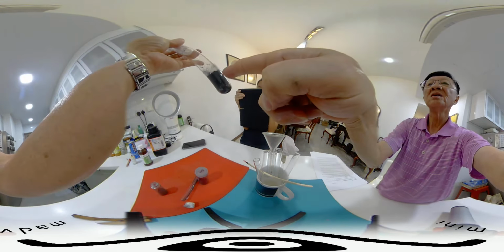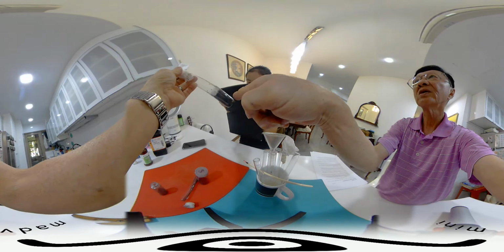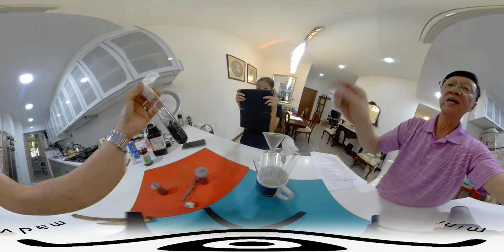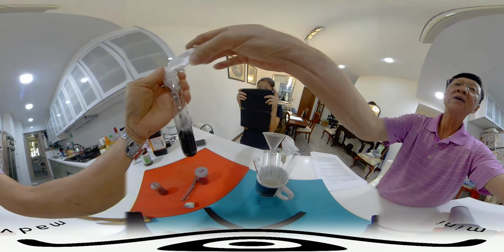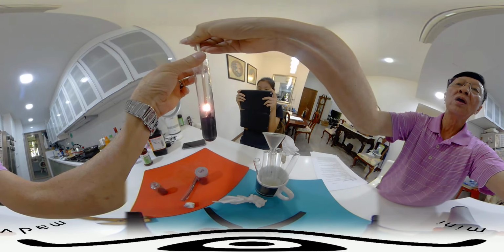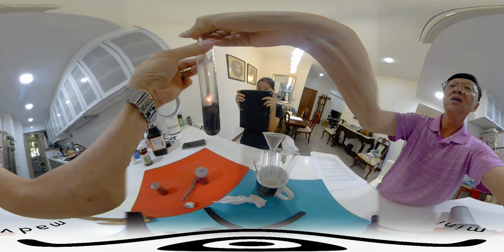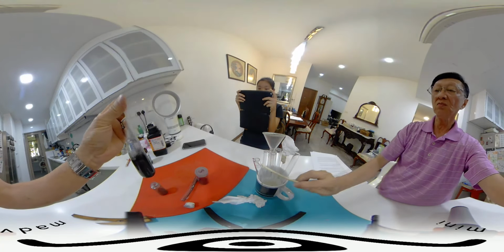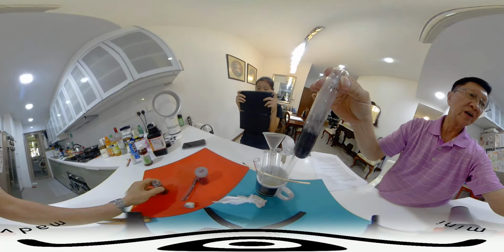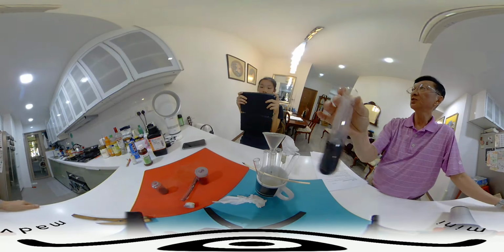Can you see the bubbles of oxygen coming out here? And now we put this glowing splint inside. Look, okay. Yay! It bursts into flame, right? It bursts into flame. So this black powder is more effective than the other black powder in the test tube.